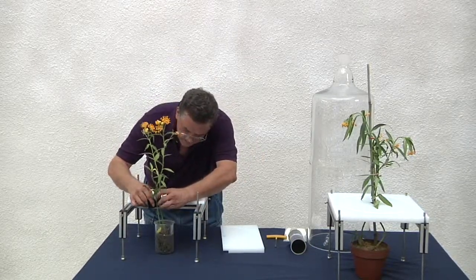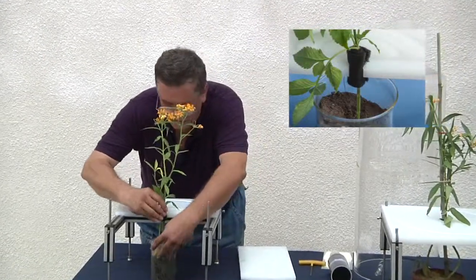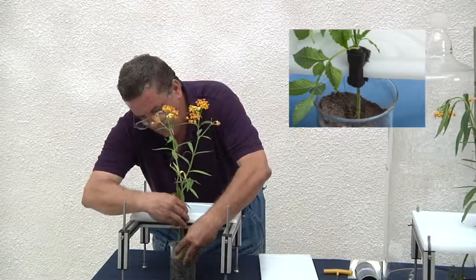Wrapping our sample plant in our activated carbon filter we slide it into place in the groove.